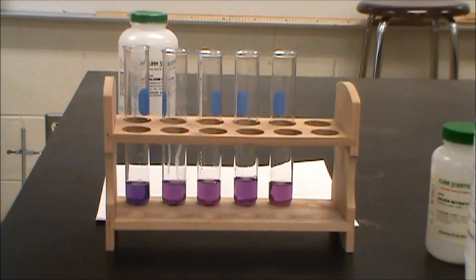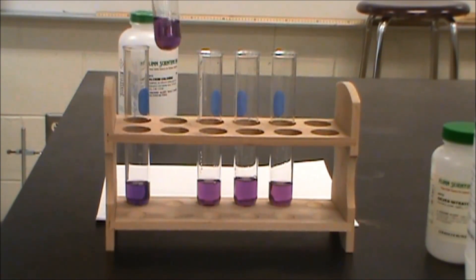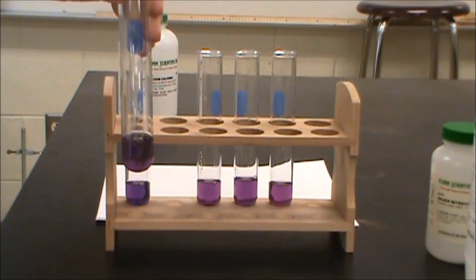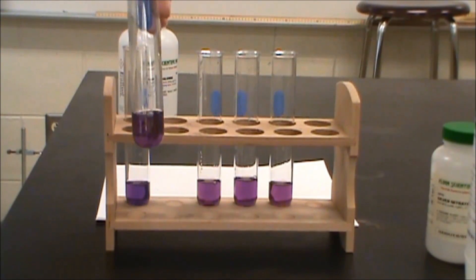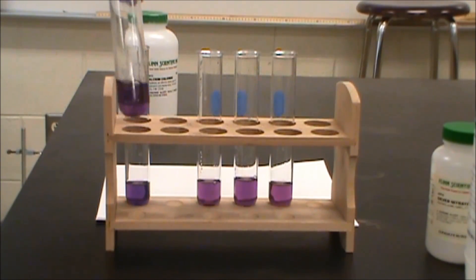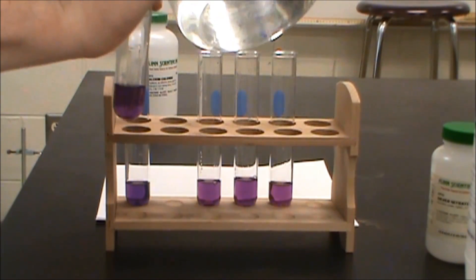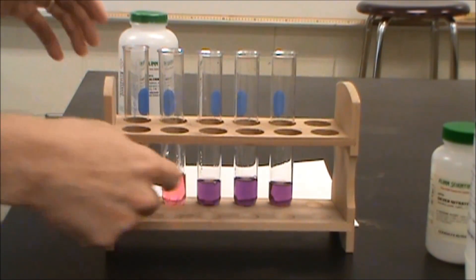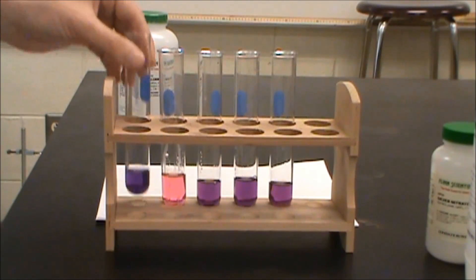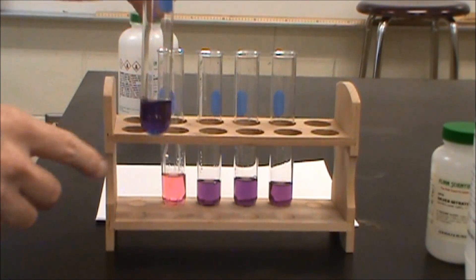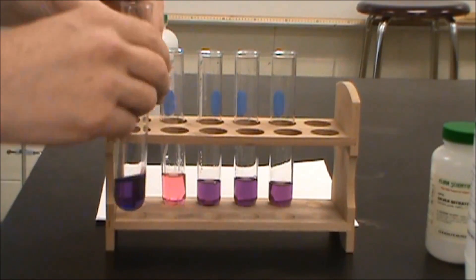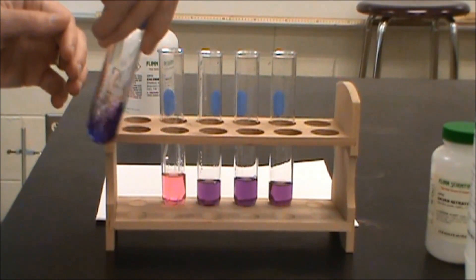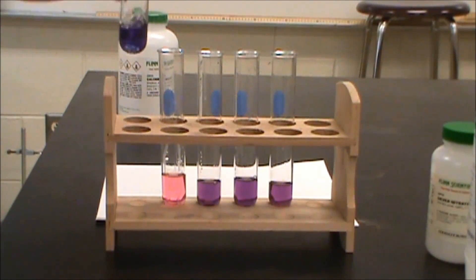So while that's dissolving we're going to the second one. We're going to add water. So if we add water that should increase the reverse direction reaction rate. We're increasing Q and that should form a pink complex. And so you'll note the distinct color change where this is now fully the pink instead of the mixture of pink and blue that we started with. At the bottom of this you can definitely see that blue color starting to fade out into the rest of the mix. So continue trying to get that to dissolve.